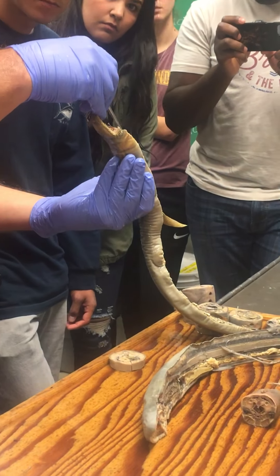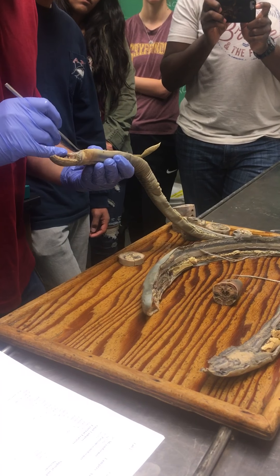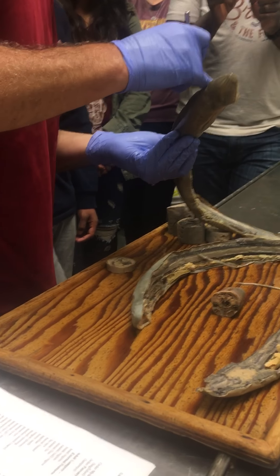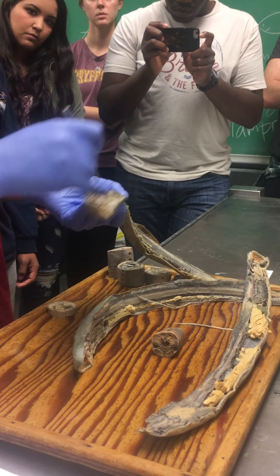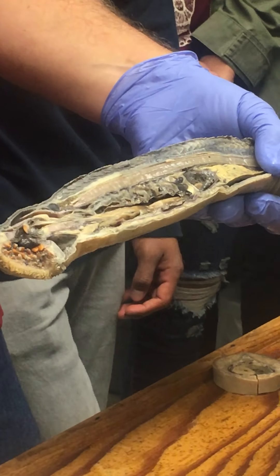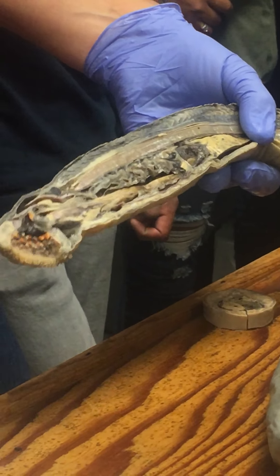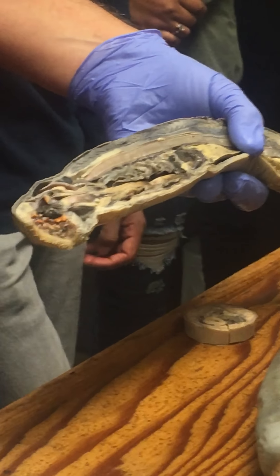Lampreys are not known for being really brainy animals, but they do have a brain. Continuing back from the brain, right in here is spinal cord, running along. The spinal cord is dorsal to the notochord — it's above the notochord — and that's the same as the dorsal nerve cord in amphioxus and tunicates. That's true in all chordates: the notochord is below the dorsal nerve cord.